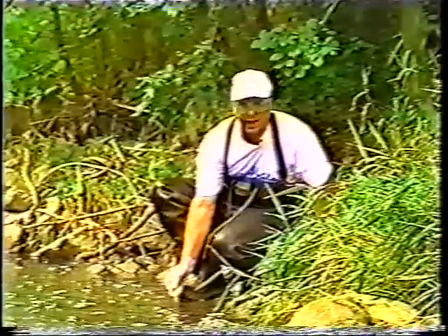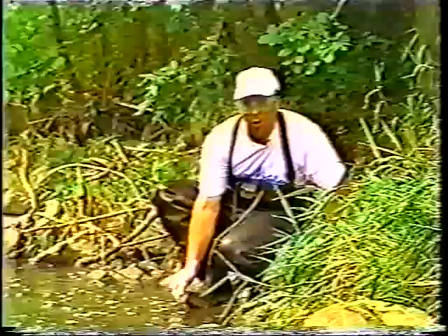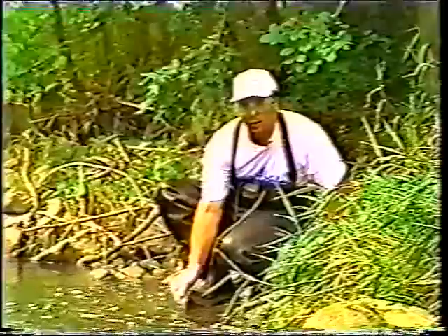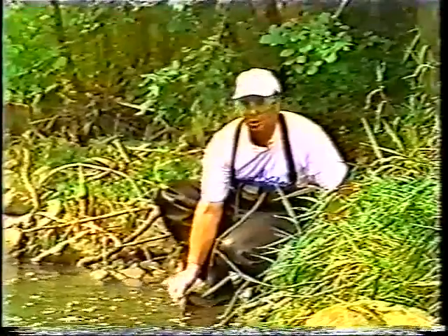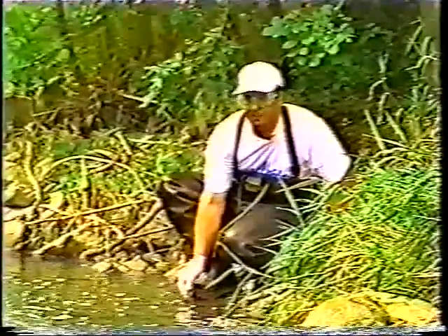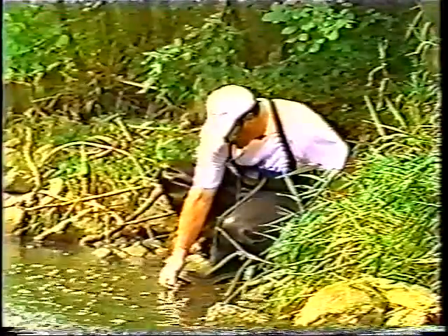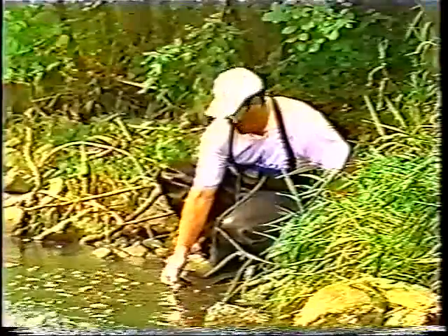You want to make sure you're getting an accurate reading of what the temperature of the stream is and not the air. One of the problems that some students have is that in order to read the thermometer, they pull the thermometer out of the water and look at it. Well, the moment you pull it out of the water, you're going to be getting the temperature of the water evaporating off of the thermometer or the temperature of the air itself. So if at all possible, angle the thermometer so that you can read it and get your reading while the thermometer is still in the water.